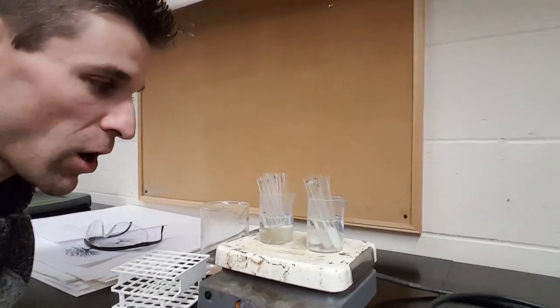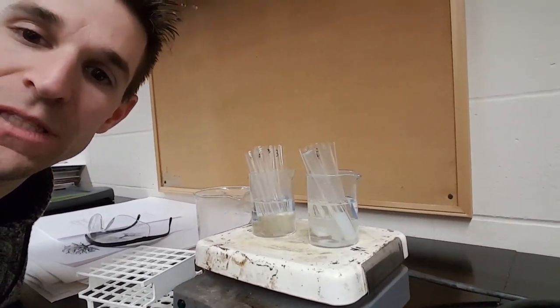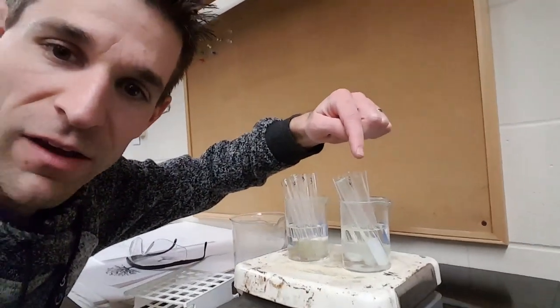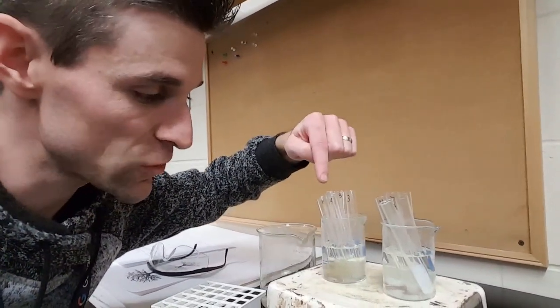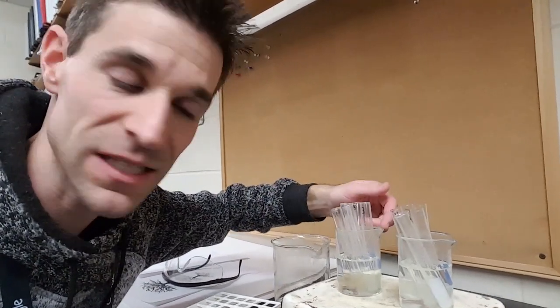Hey, biology students. So here are our test tubes that we were assembling today. These ones over here have the water in them, and these test tubes over here have the bits of banana DNA that we isolated.